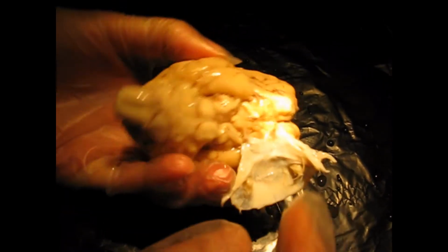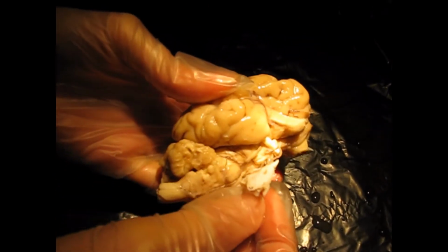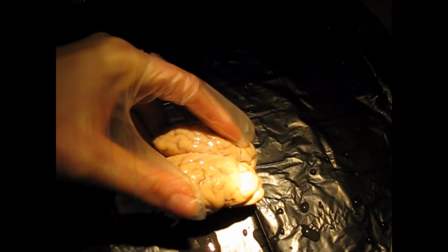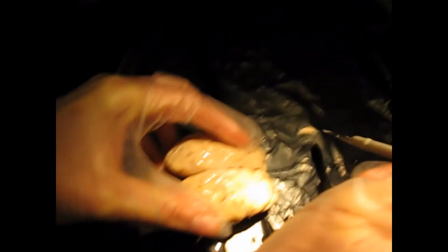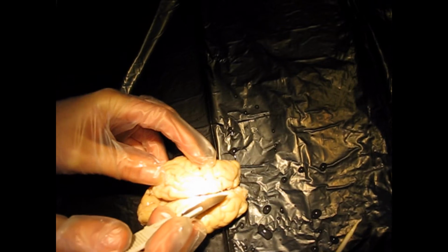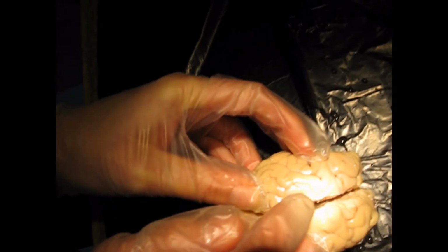So between the dura mater, which is here and would be wrapped around the whole brain, of course, and the pia mater is the arachnoid mater, right? And then the cerebrospinal fluid travels between that. Okay, so when you make your incision, you want to try to stay as mid-sagittal as possible. The more medial you are, the better your dissection will be, and the more structures you'll be able to identify. So you would just start anteriorly and cut all the way through.